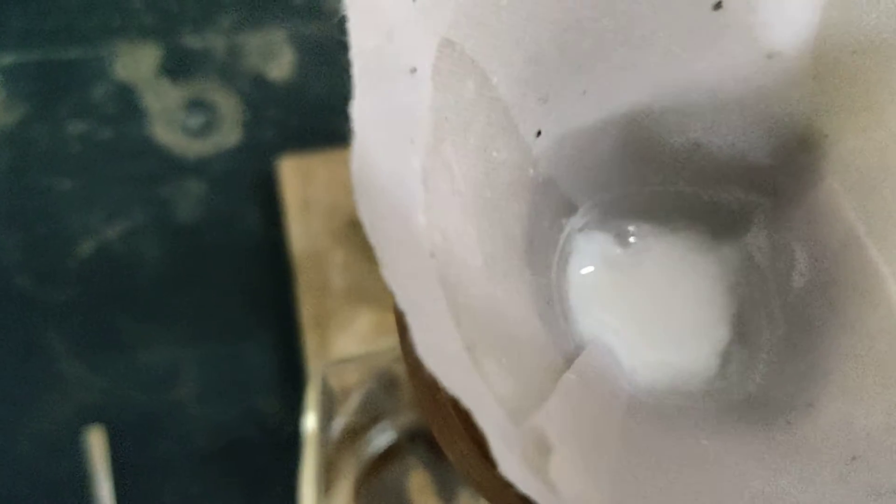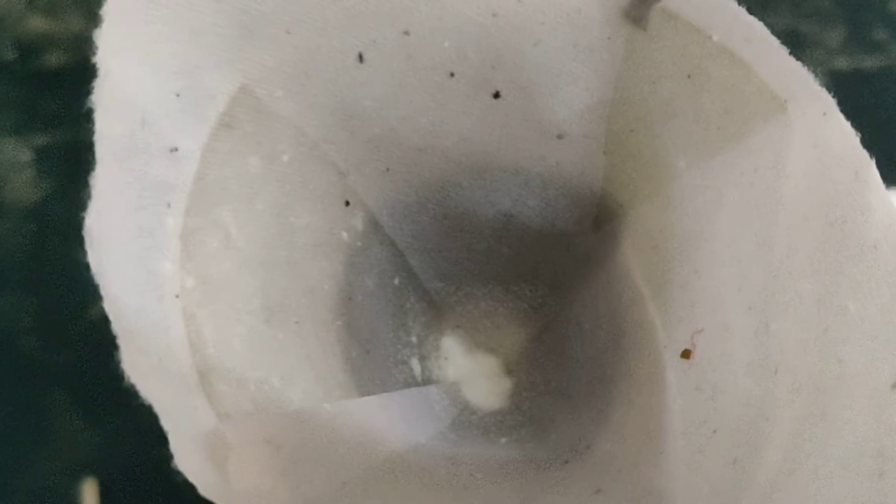We have micro-scaled the experiments in order to minimize wastage. You know that. So you have to be very careful in performing this experiment. And the way you wash it - everything becomes important here.